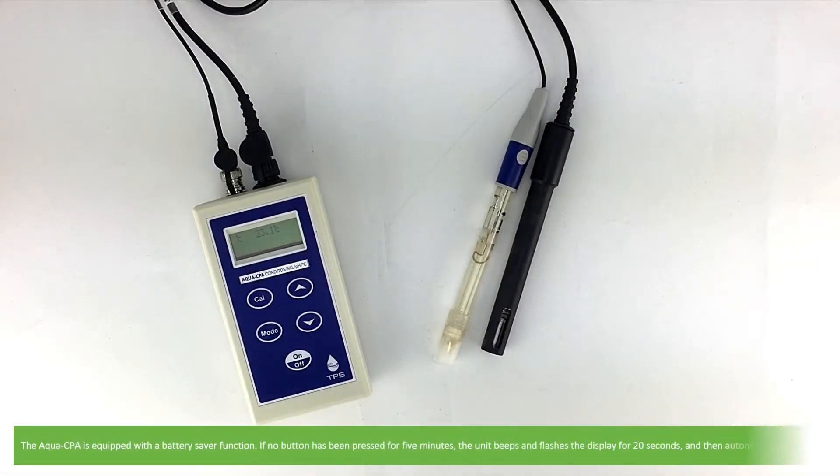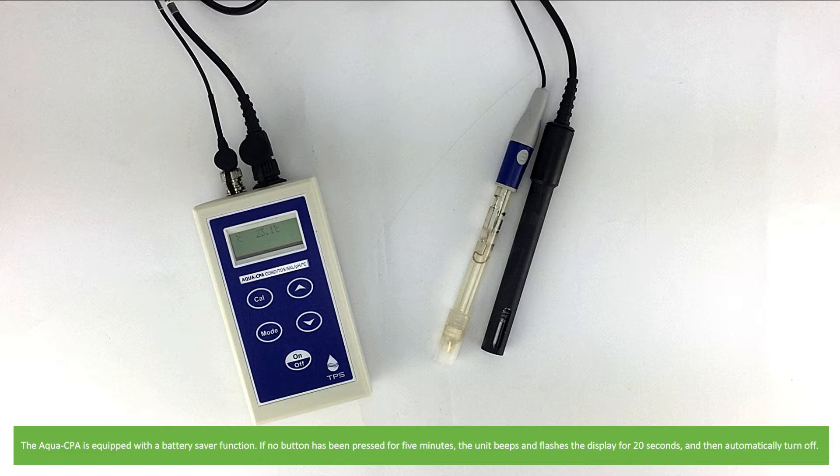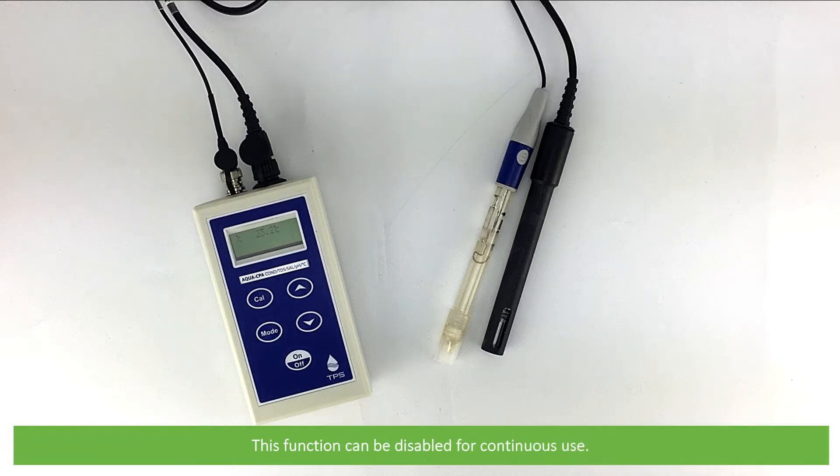The Aqua CPA is equipped with a battery saver function. If no button is pressed for 5 minutes, the unit will beep and flash the display for 20 seconds and then automatically turn off. This function can be disabled for continuous use.